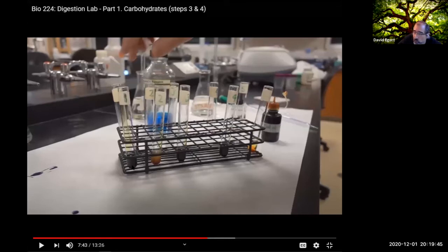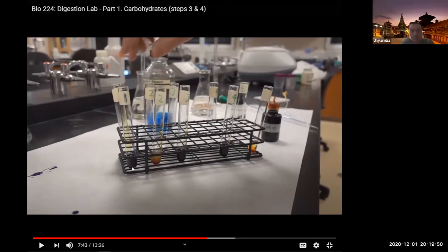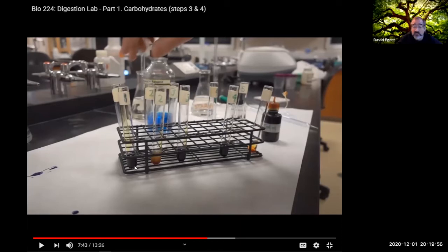All right, so if you just take a look at it from here, what are you thinking about test tube 1? Is there starch in there or not? Yes. So that black purple means positive for starch. And hopefully that's kind of what you were thinking, right? It's nothing in there but starch and water. It doesn't break down on its own.